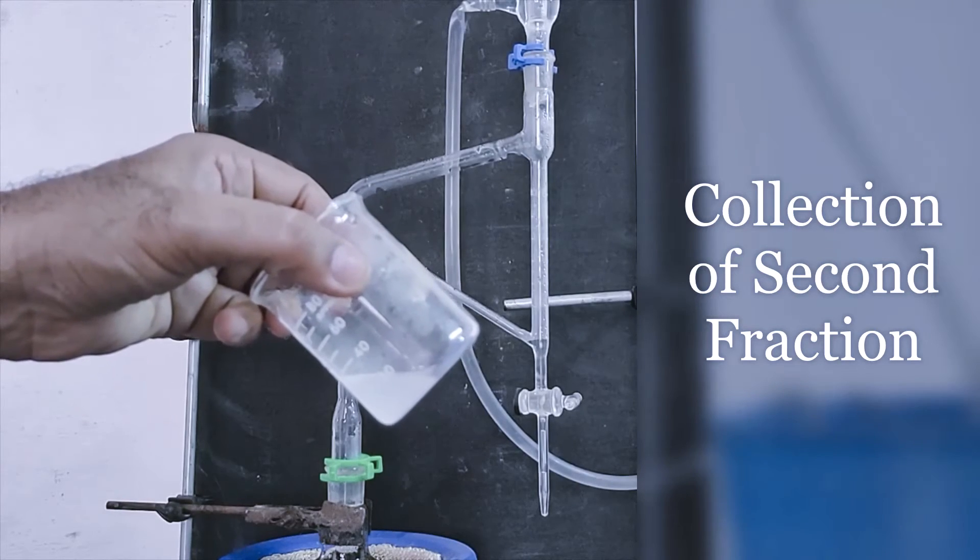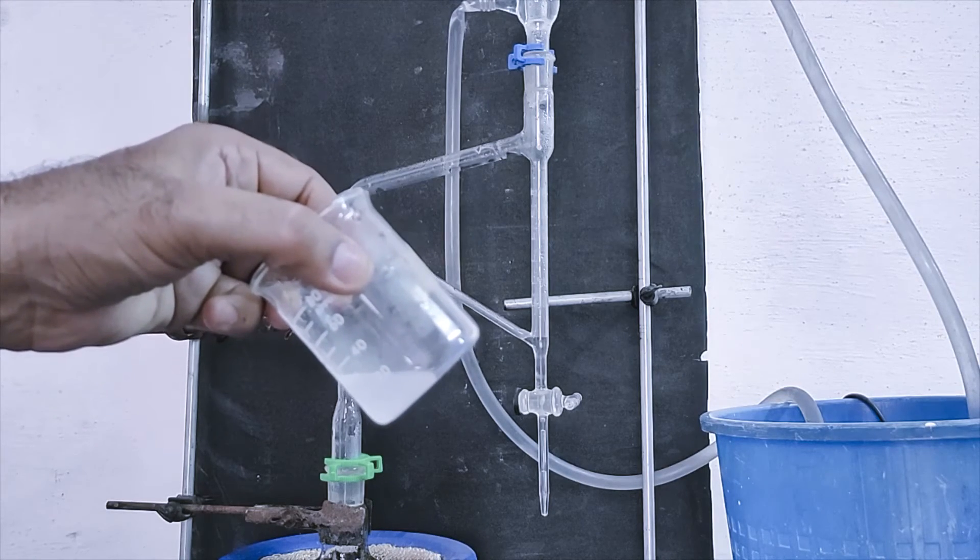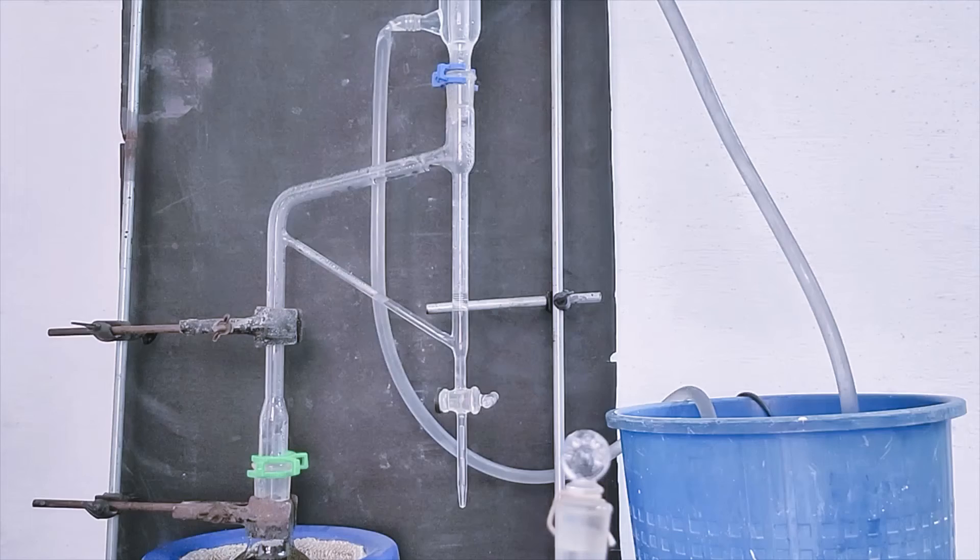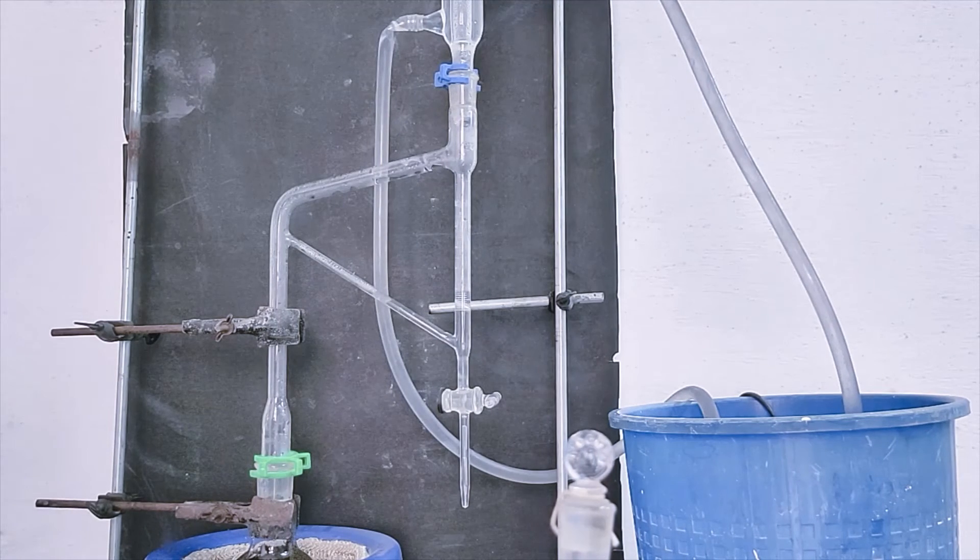This fraction also in the form of emulsion, that's why I will mix up both the fractions. After completing second fraction, third fraction is continued.